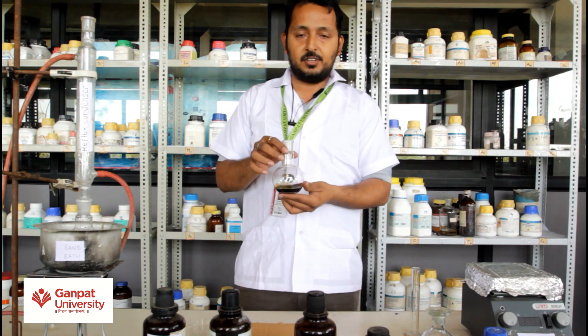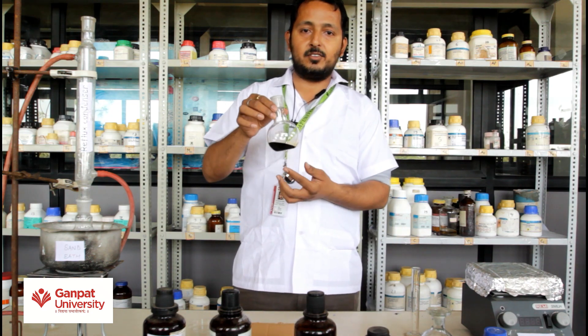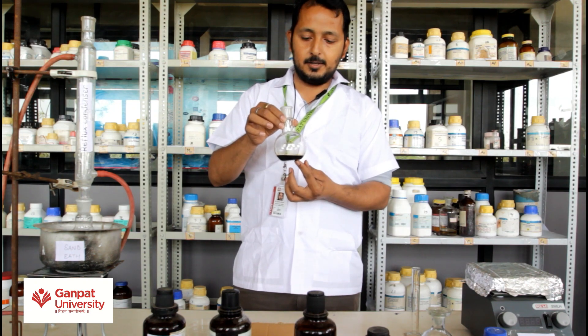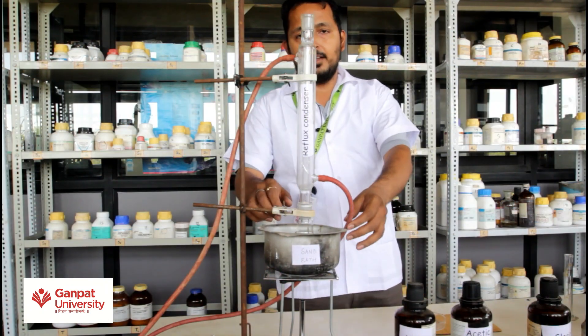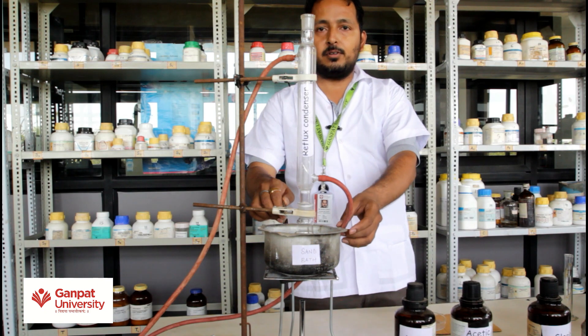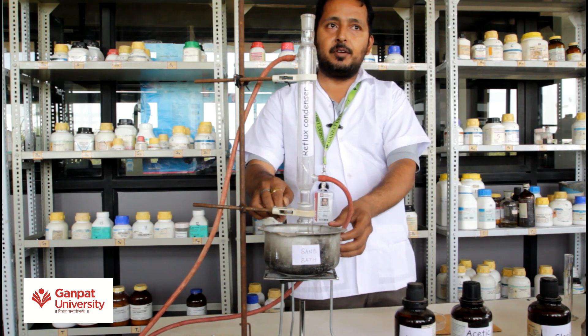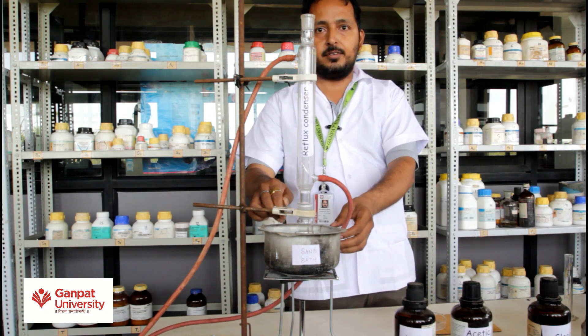Now this mixture appears in a dark brown color. Now the entire mixture is refluxed on a sand bath for 10-15 minutes at 80 degree temperature.